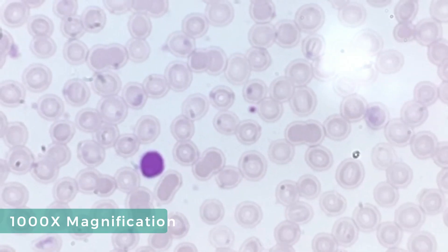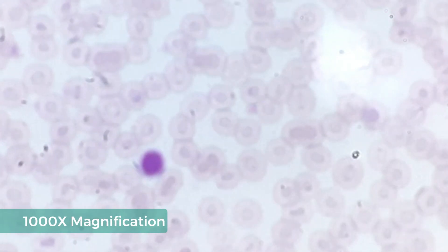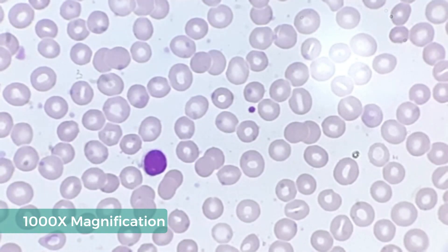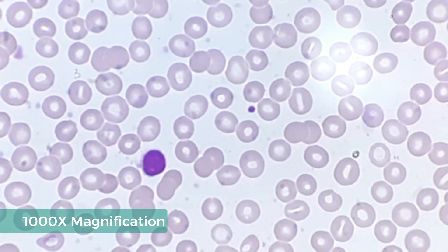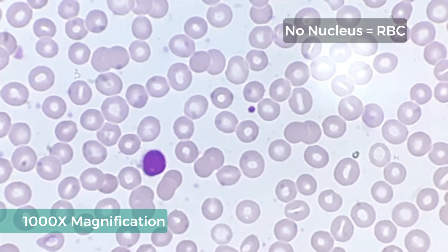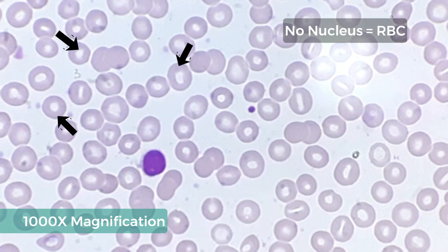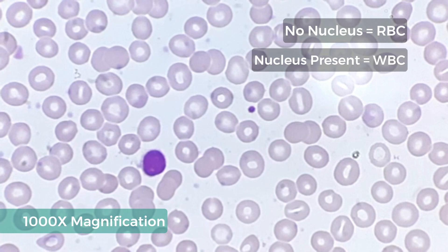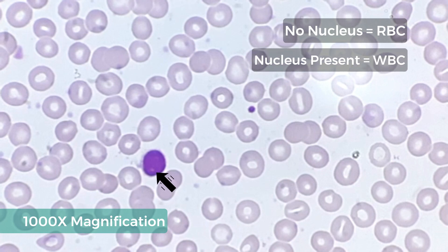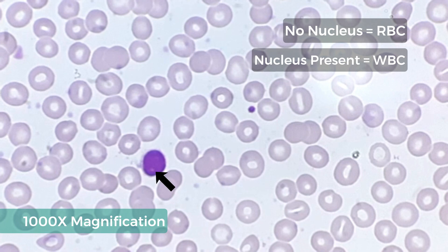The trick to identify blood cells is: first, find out if there is a nucleus present or not. No nucleus is present in normal RBC. If there is a nucleus, it might definitely be any WBC among their five types.